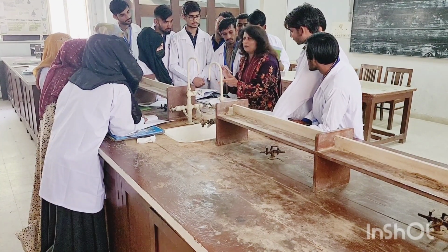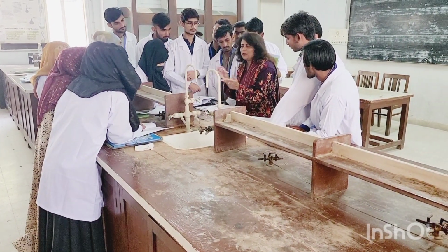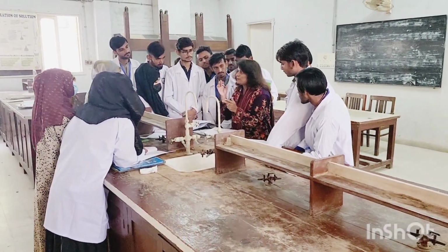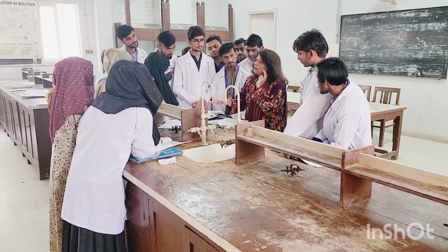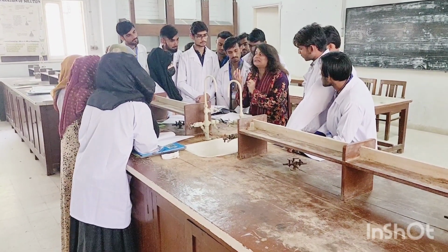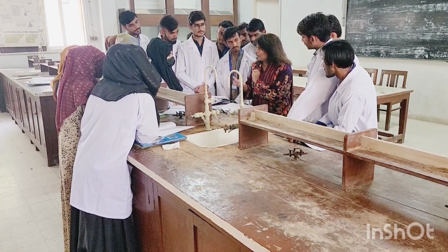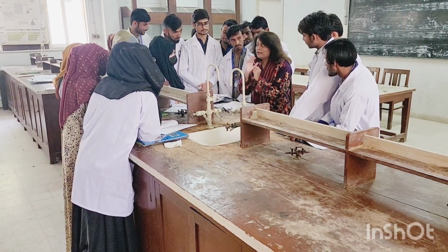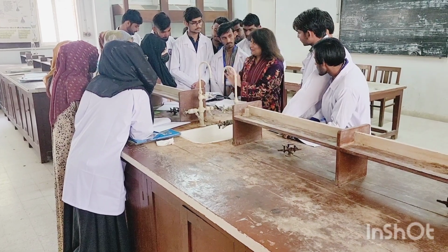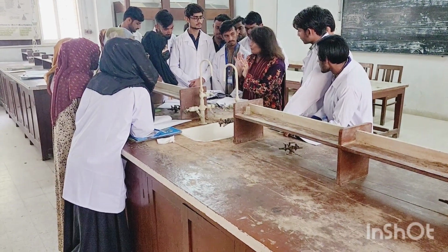You will write down that the compound dissolved at room temperature. Whereas if it doesn't, you will adopt the second option. That is, you are going to try to dissolve it on the flame. You will increase the temperature. And with the rise of temperature, if you see that your compound gets dissolved, that means this is the suitable solvent. You will mark that solvent.